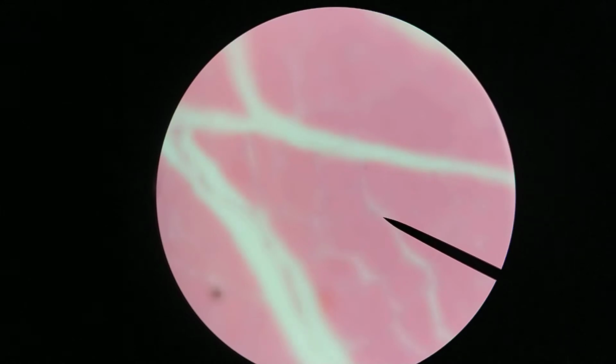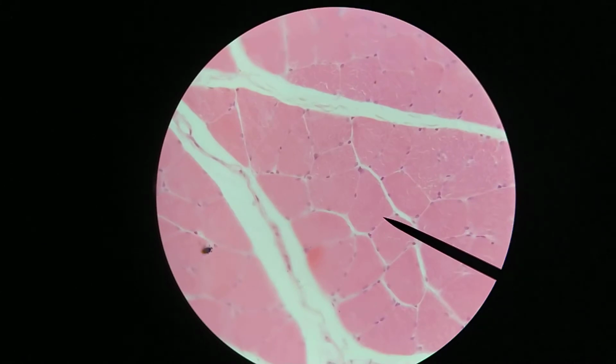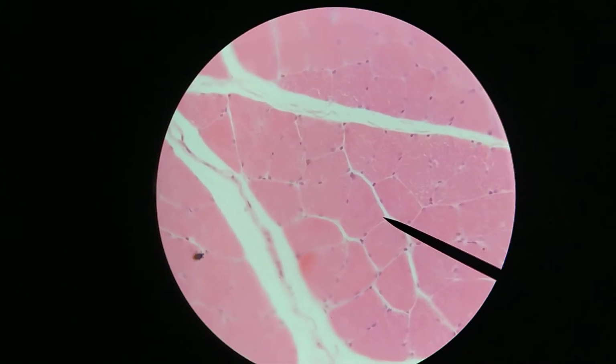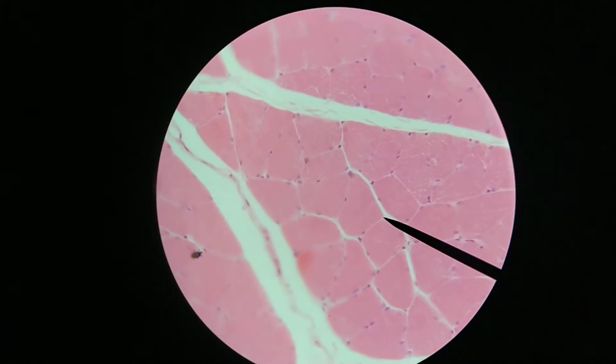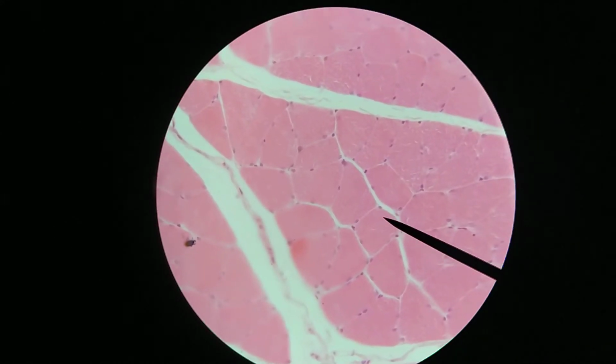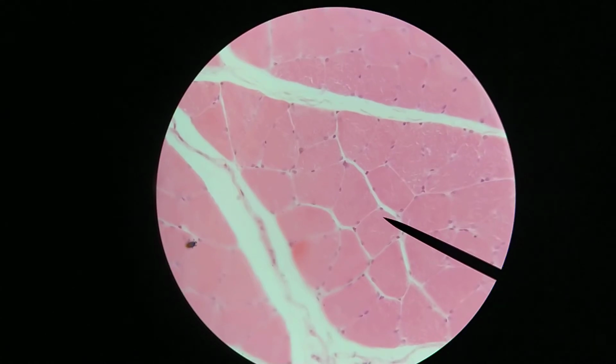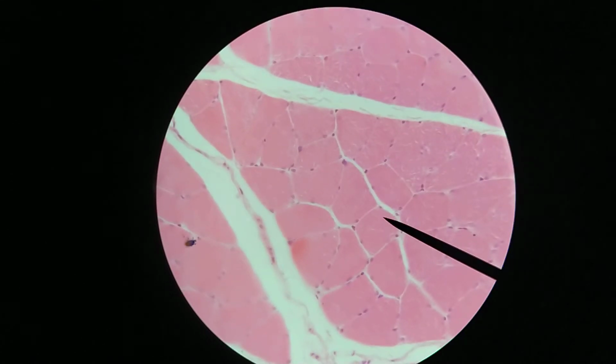So let's zoom in again, go to 400x magnification. And here, just looking at the same fascicle, you can see multiple cells. Each one of them has multiple nuclei. So here's one nucleus. This stage control mechanism is a little bit fussy. Okay, so here's one nucleus, and you can see around the cell multiple other nuclei as well. So again, very typical skeletal muscle, nuclei around the edges. The cell itself is just filled with protein.